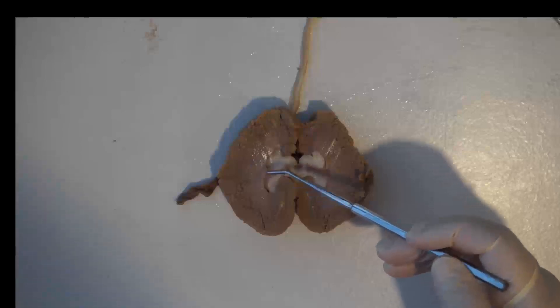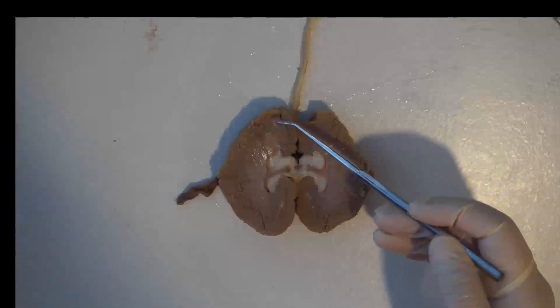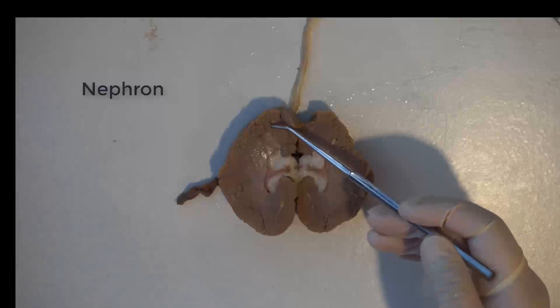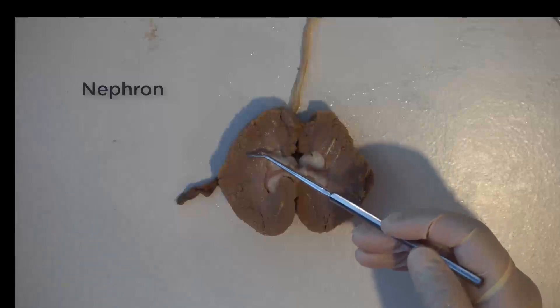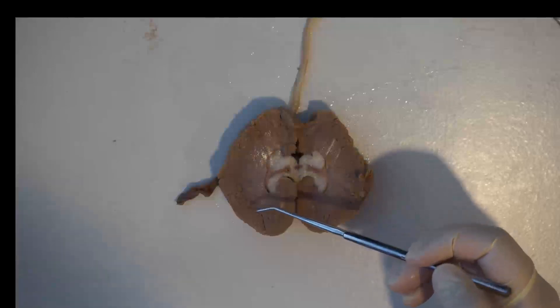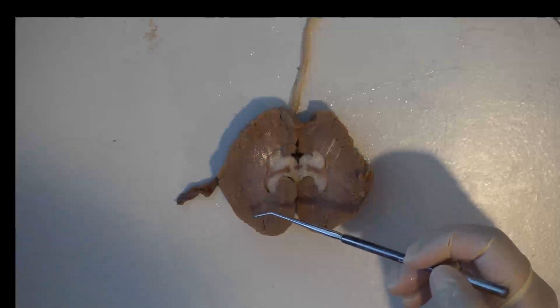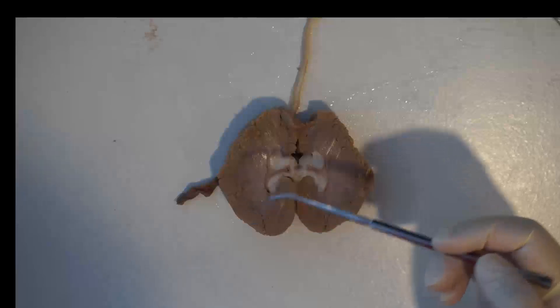You'll find the nephrons, which are the functional unit — essentially the cell that makes urine. You'll find those nephrons between the renal medulla and the renal cortex.